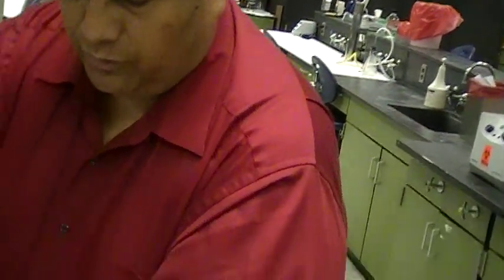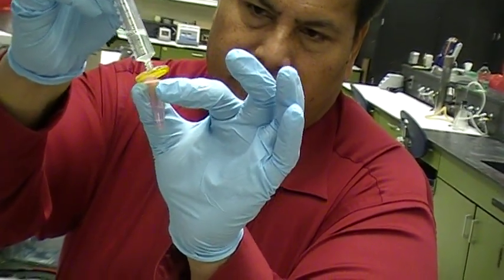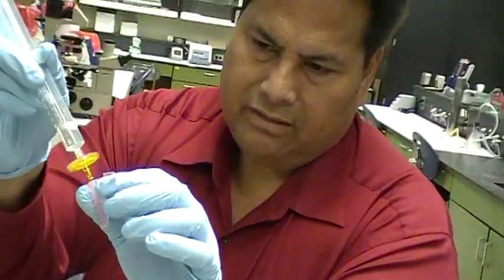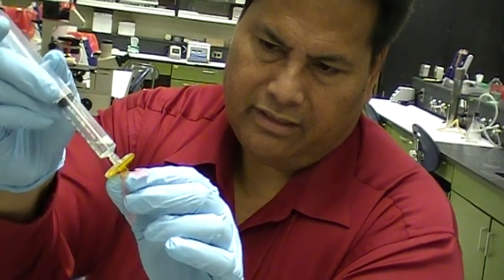Okay? You pick this up, change the tube out, and you continue. You do the same. Pick this up, filter into another tube. Okay?